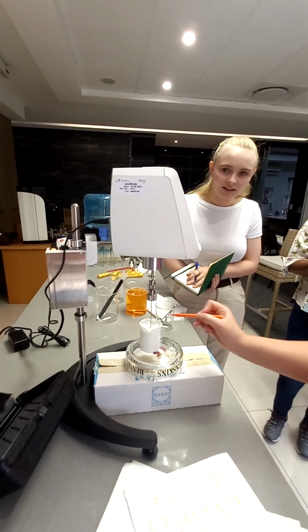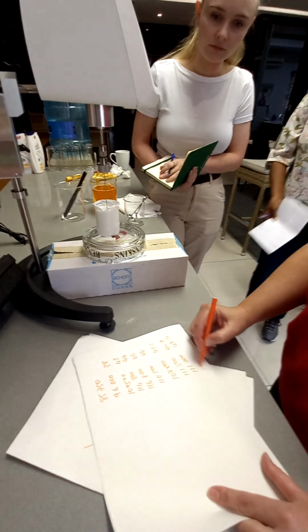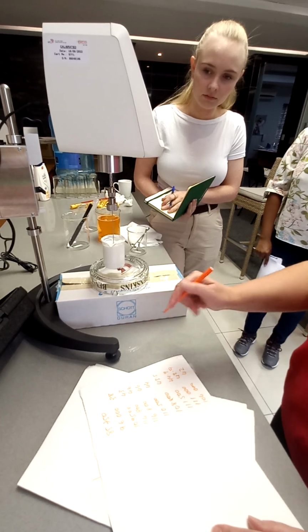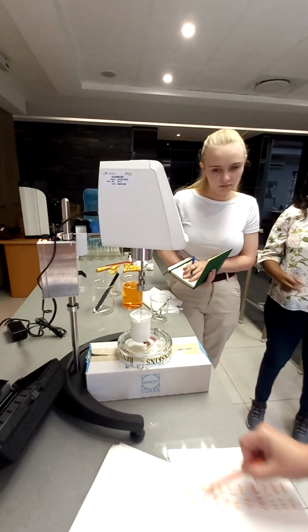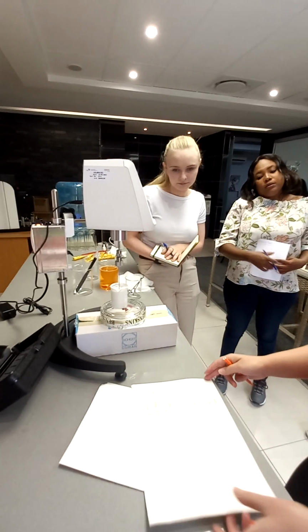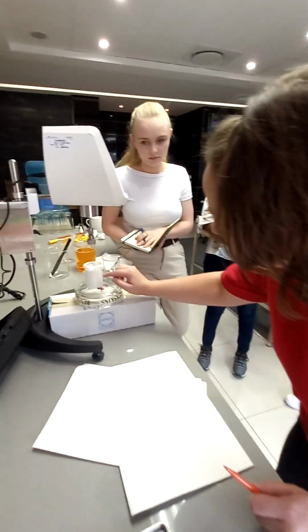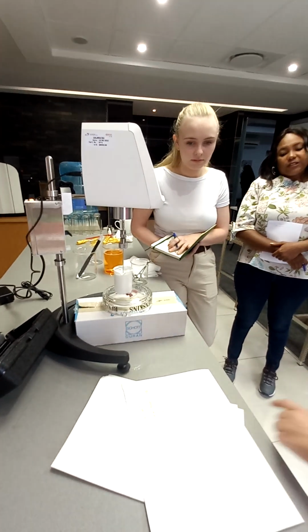43.7. I just want to see what the value would be as it comes out. Let's do 106.42. That's going back down. Okay, so here's my values. I would discard these two. I think it was more towards the top where it's thinner. Okay, so I would say that's good. Might be a better idea to start taking readings once you're maybe halfway in. But they're more or less the same.